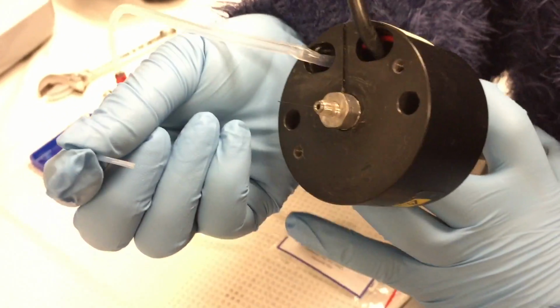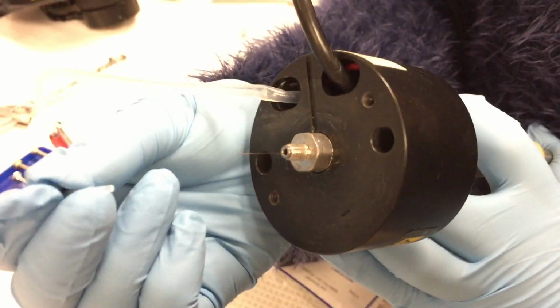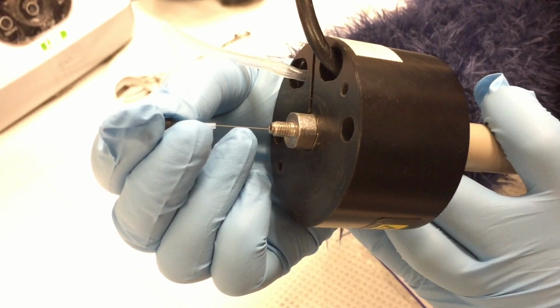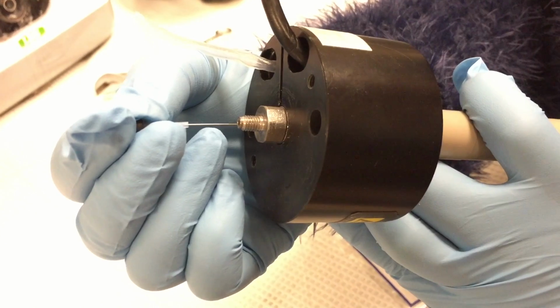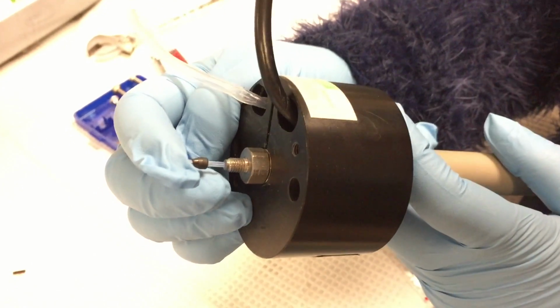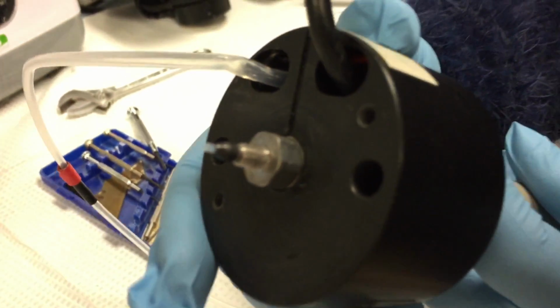Next, I'm going to feed the small capillary into the small inner diameter of the PTFE tubing with the graphite ferrule attached. And I'm going to push it in so that the capillary is pretty much flush with the end of the PTFE tubing.